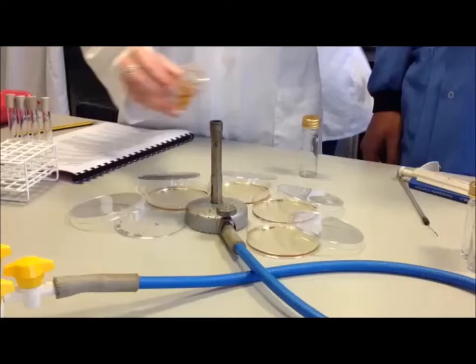This is a short clip with a student demonstrating a really nice pour plate technique. You can see the agar plates have been arranged closely around the Bunsen burner, which affords a certain degree of protection from microbes falling from the air.